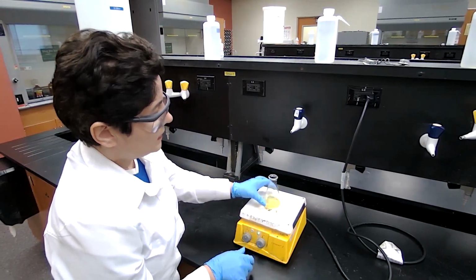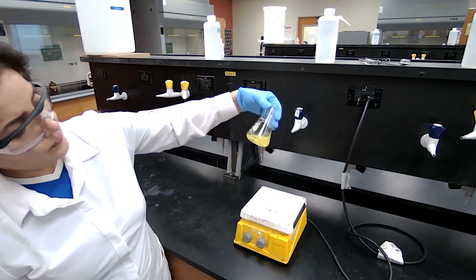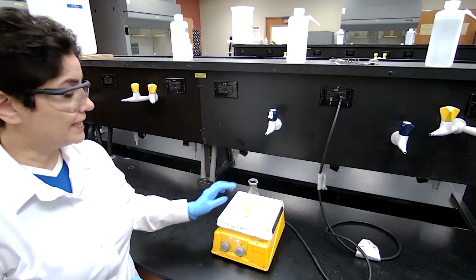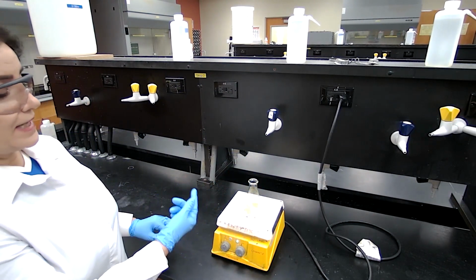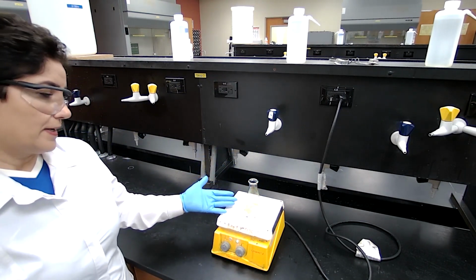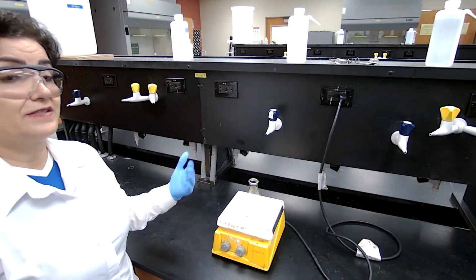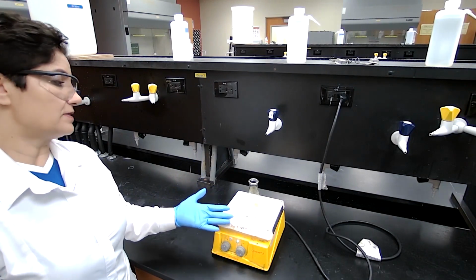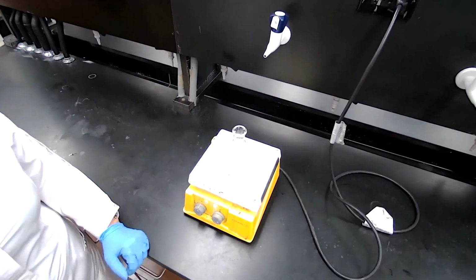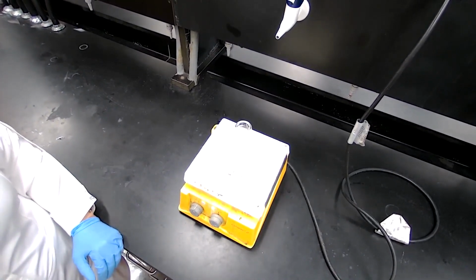to complete. So as the reaction proceeds, you see that right now we have a yellow solution. The product is white and it's also insoluble, so you will see that a white precipitate is going to form. If the yellow color disappears completely, we can stop the reaction. If it's 30 minutes and the yellow color has not disappeared yet, we add more of the sodium borohydride to make sure that the reaction is complete.